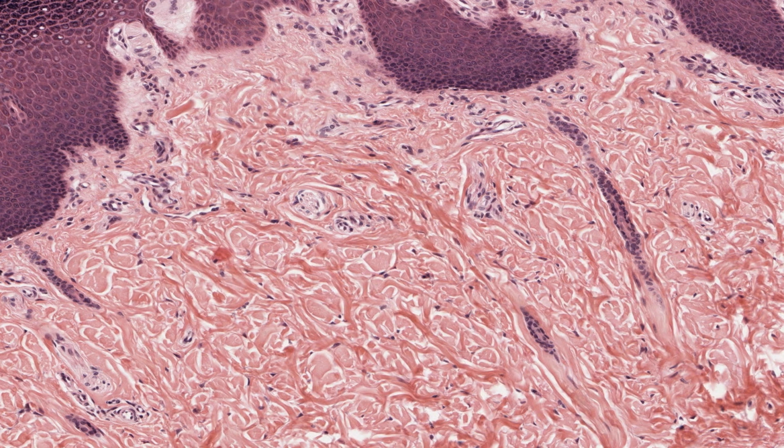They run in many different directions. Some are cut transversely. Some run in the plane of the section for appreciable distance, but most are cut obliquely. So we would further classify this as dense, irregular connective tissue. This is actually very important in the dermis of skin, as it can then dissipate the shear and compressive stresses on skin in many directions and so absorb this stress.